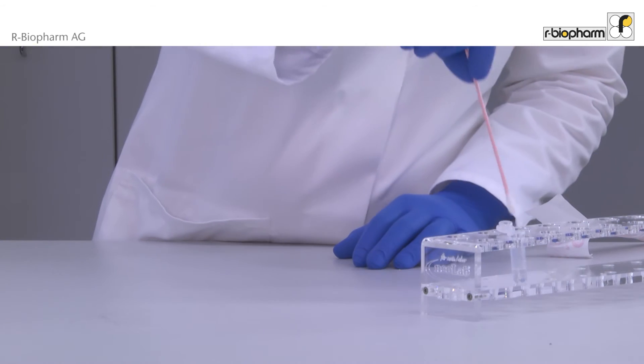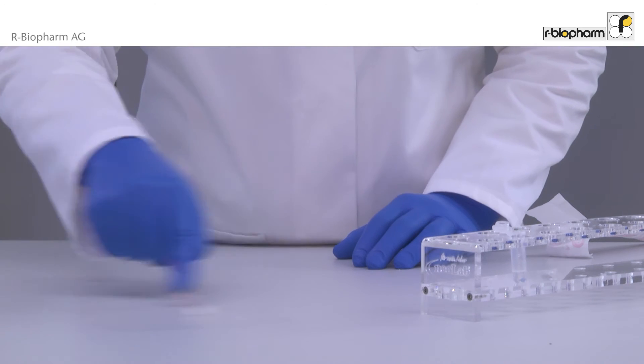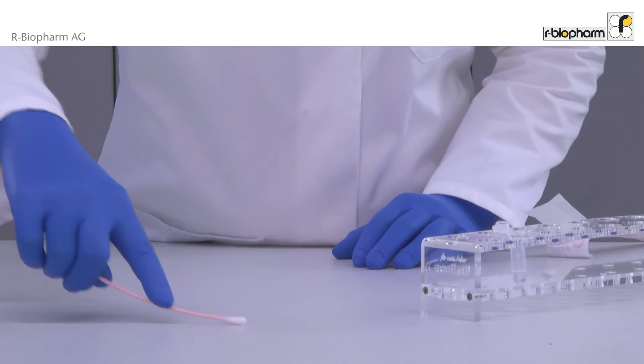The swab is dipped into the buffer vial. Then swab the surface while rotating the swab head in a crosshatch or zigzag pattern.